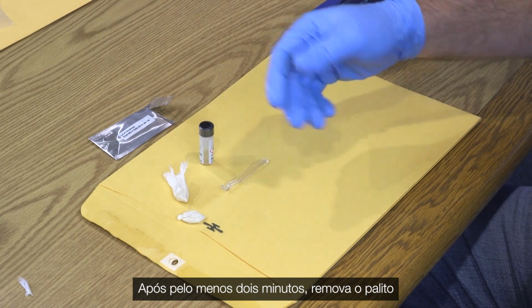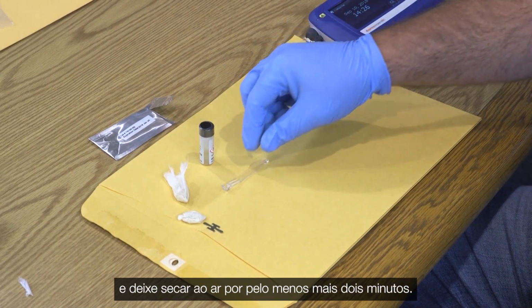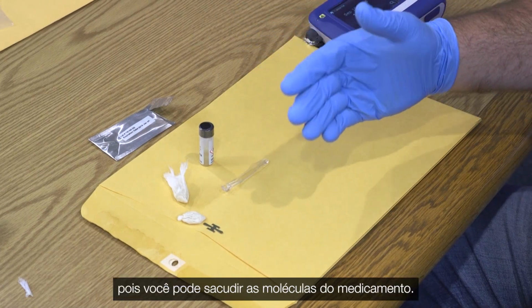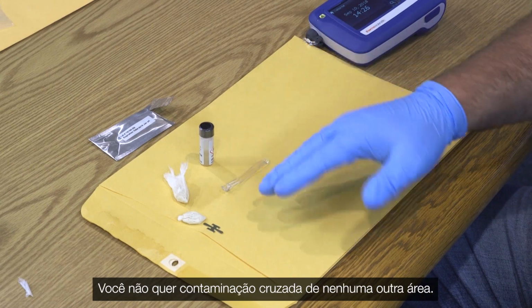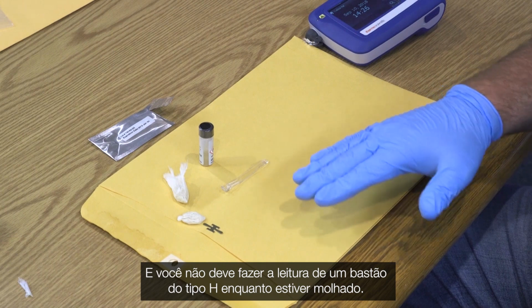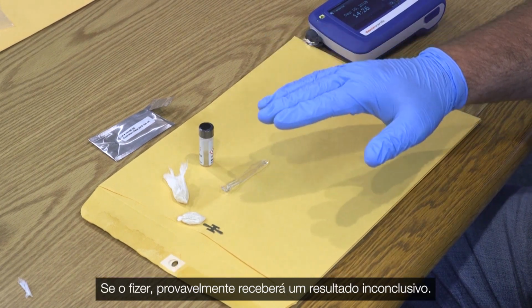After at least 2 minutes, remove the stick and let it air dry for at least another 2 minutes. Do not shake the stick to dry it, as you may shake off the drug molecules. Place the stick down on a flat, sterile surface. You do not want cross-contamination from any other areas. You do not want to scan the Type H stick while it is wet. If you do, you will likely receive an inconclusive result.